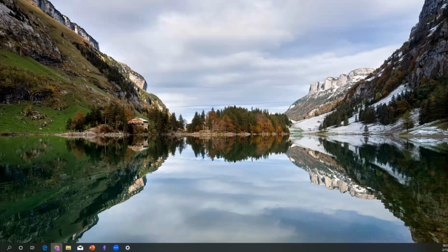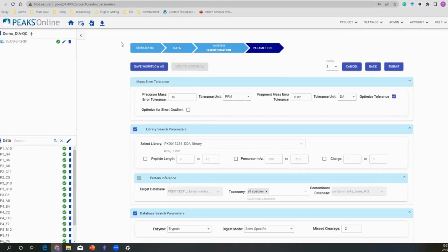So one moment. So here is the setup of our label-free quantification. In the previous part, you set up your data searching parameters and upload data. I'm not going to do too much about this since there will be another webinar next week. I hope you can all join to take a look at our DIA workflow.